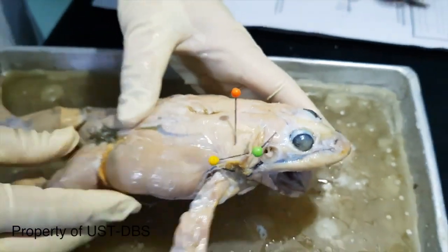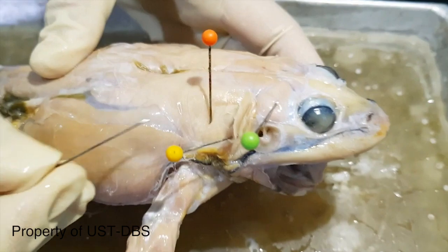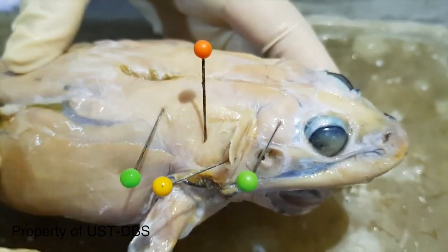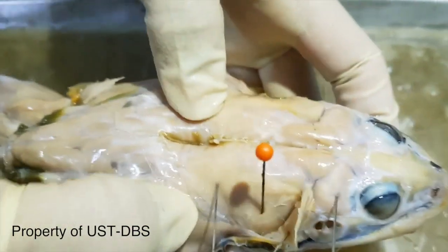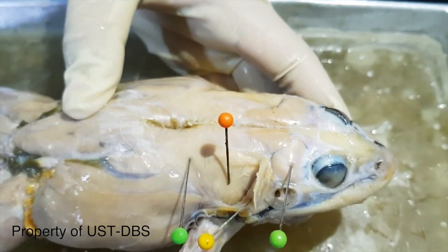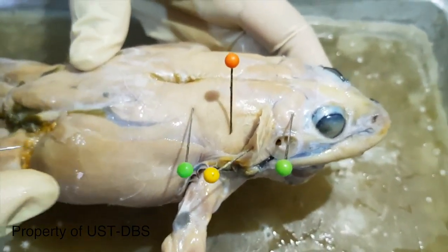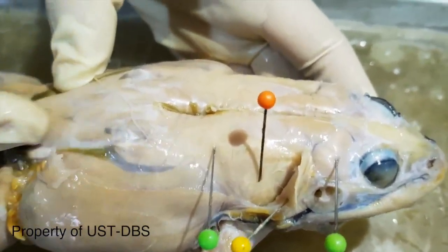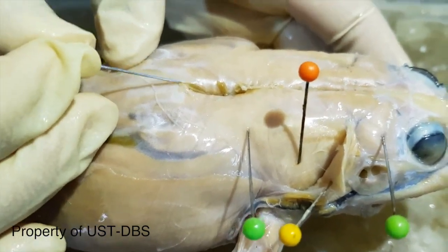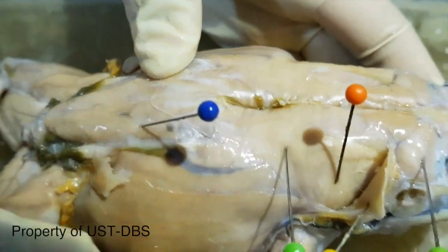Then as you go downward, caudal, this one is the longissimus dorsi. It's triangular in shape. And on the side, going caudal, this triangular shape that meets at the middle is the coccygeoiliacus.